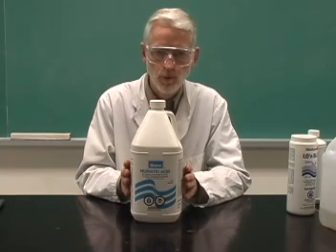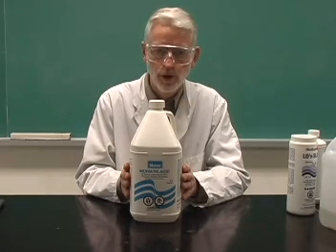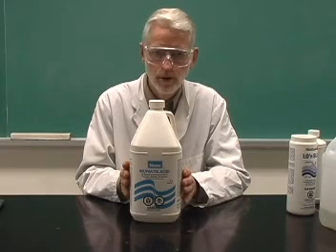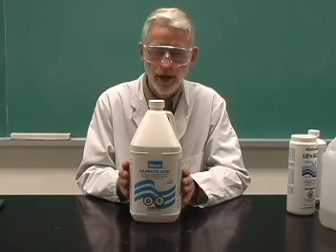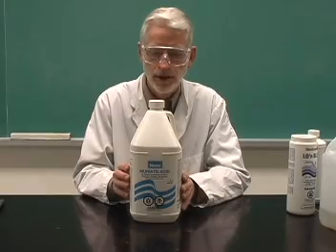So if you want to make a 1 molar solution, you take 10 mils of this and 90 mils of water and mix the two together to form then a 1 molar solution of hydrochloric acid, which we simply abbreviate with the letters H, capital C, small l, HCl.